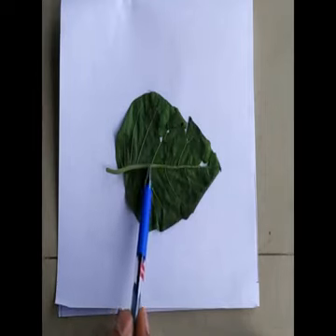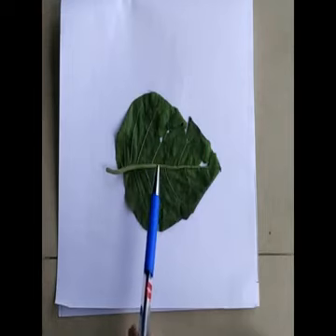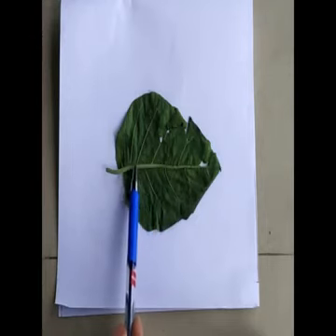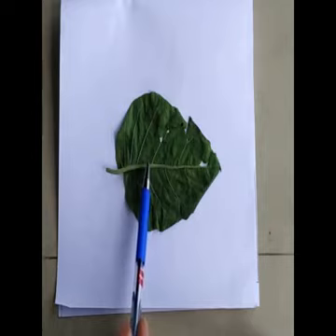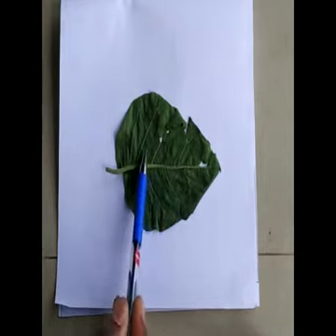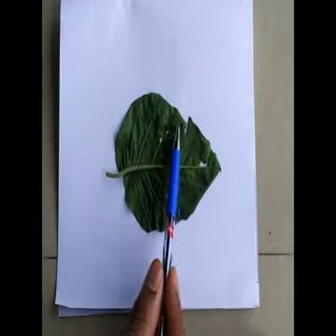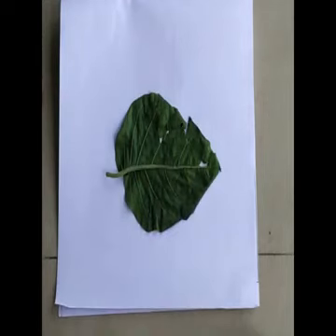The mature region gives a good quality of internal anatomy, and the tissue present in the mature region can be easily differentiated. So we are going to take a section through the lower 1/3 region of the leaf. The upper part can also be used for surface microscopy.